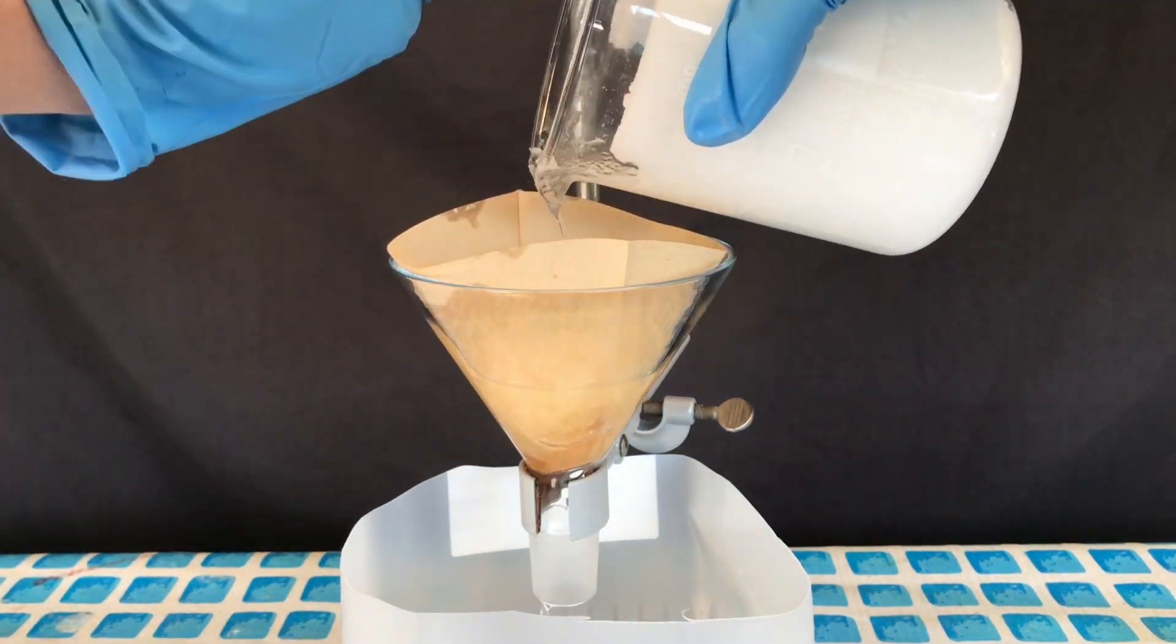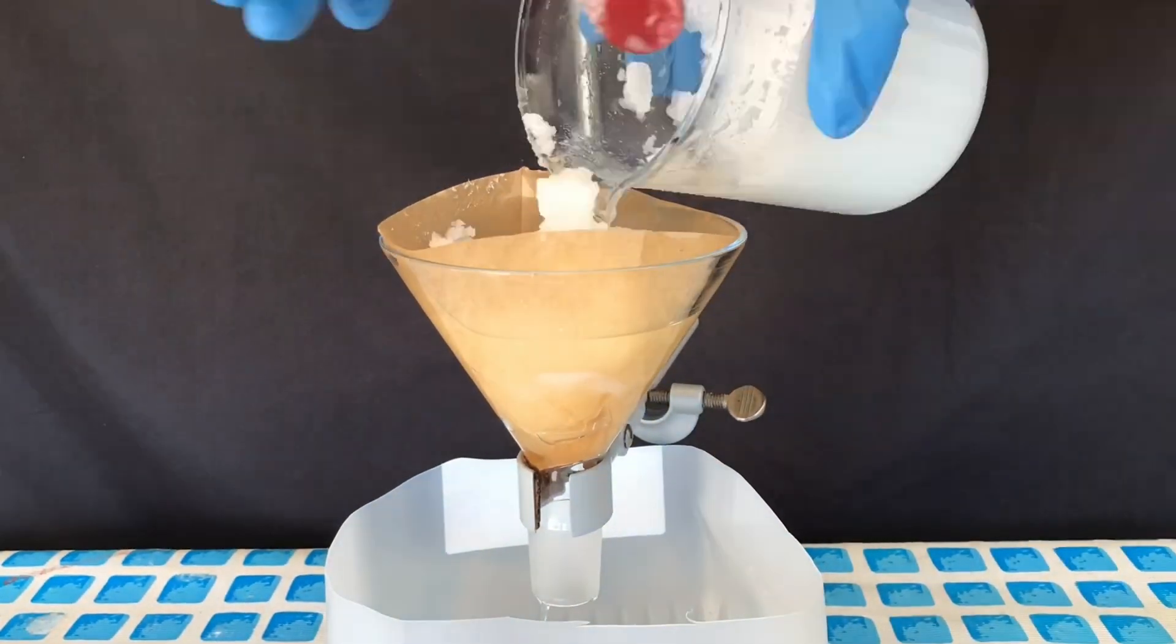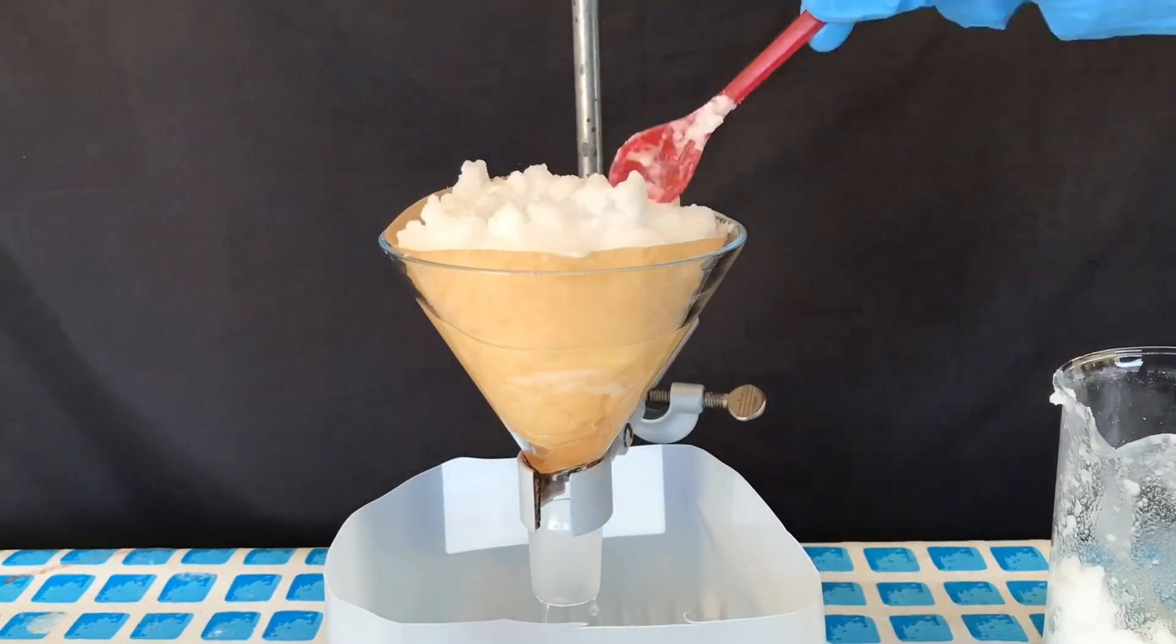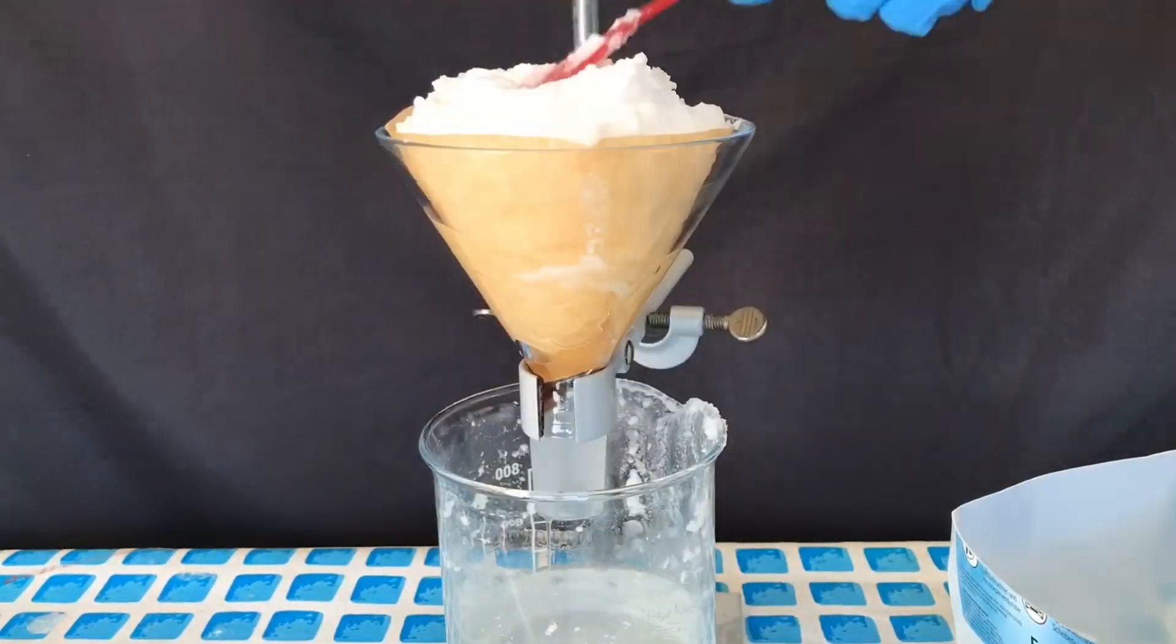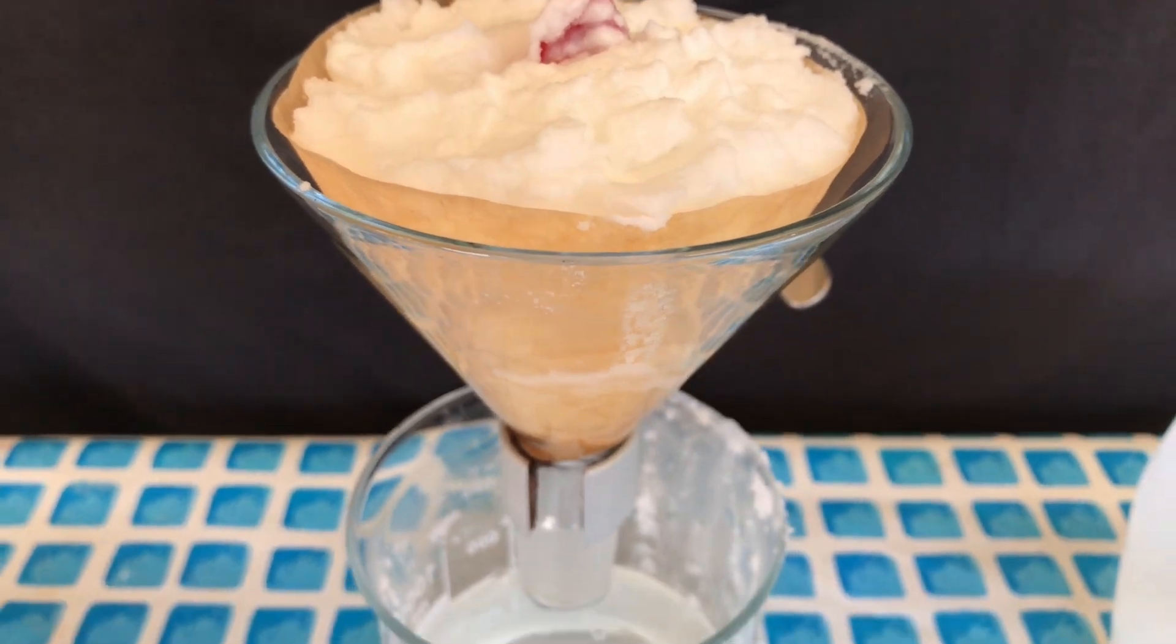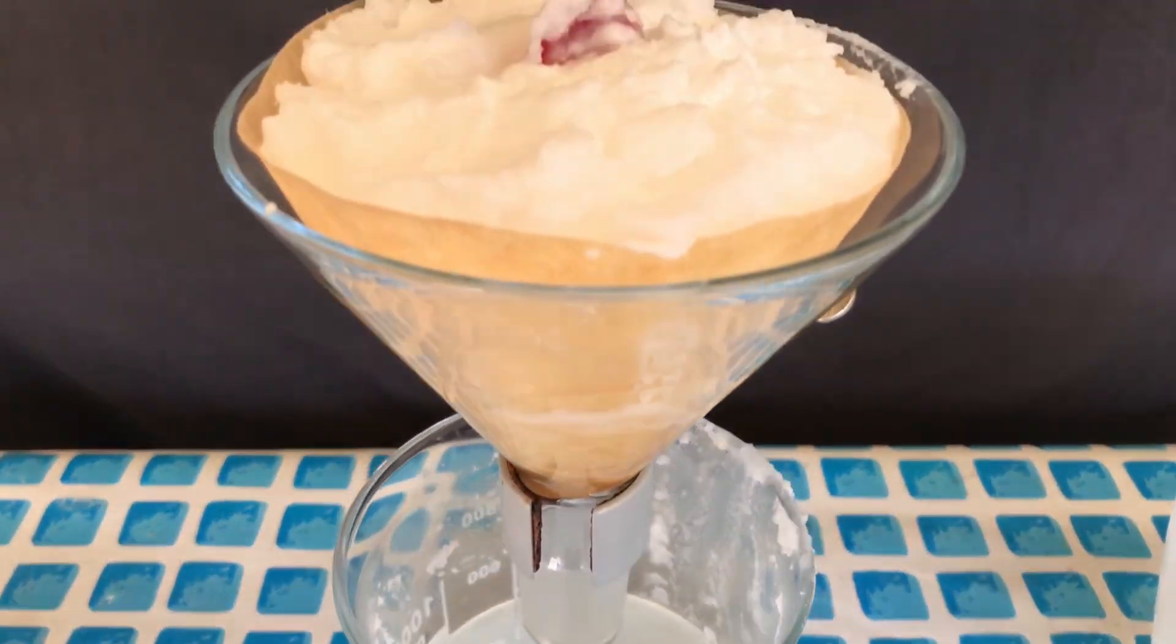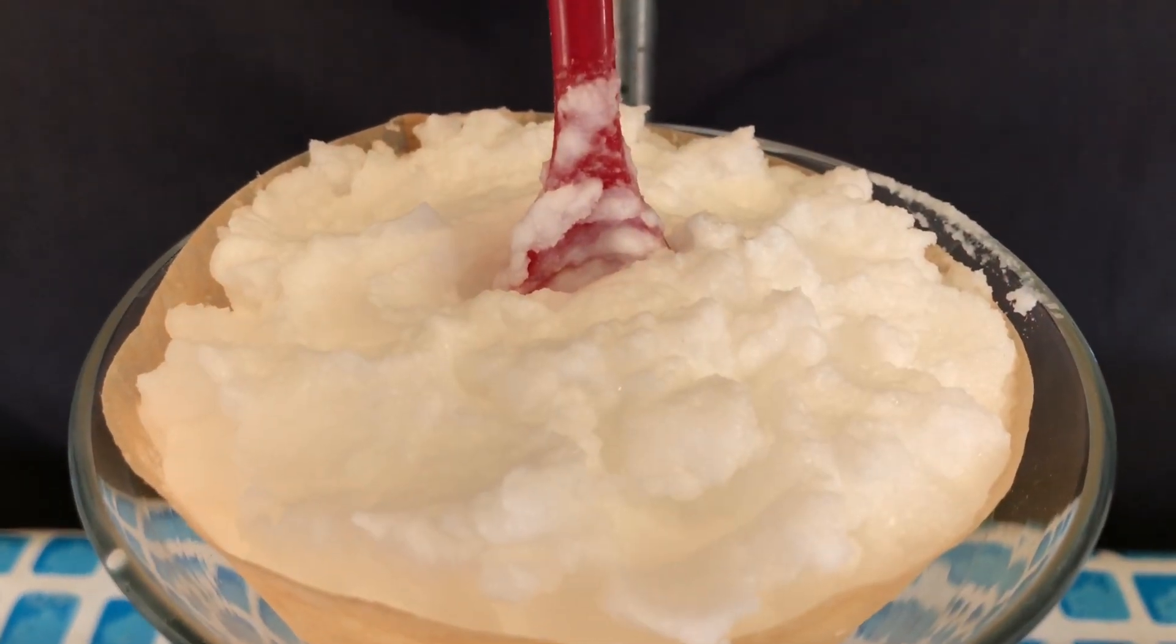All crystals were scraped into the filter and the isopropanol water mixture just poured right out. Hitting it with a spoon helped enormously to get more of the solvent out. Have a look at the still wet product. It's fluffy, white and it looks clean.